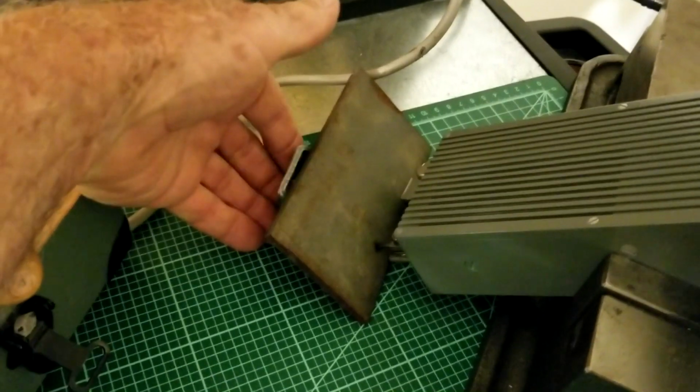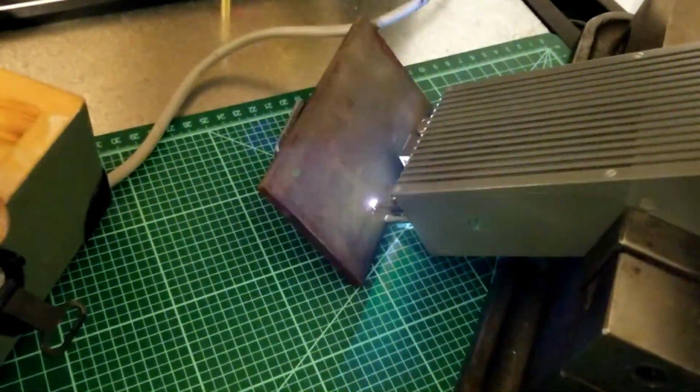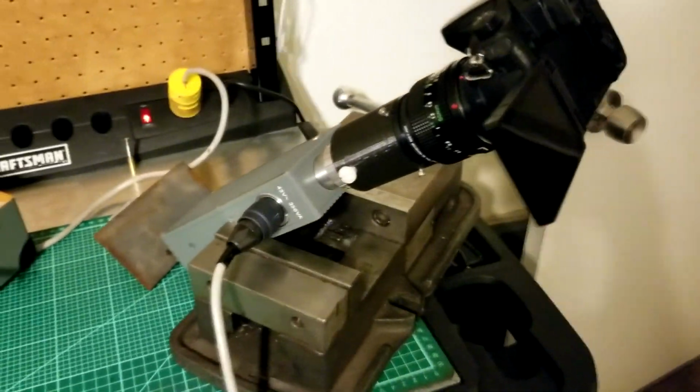I have the camera on. If I turn the power on, I see nothing on the screen. And I'm rotating this full throughout its entire range. And as you can see, absolutely nothing appeared on the screen.